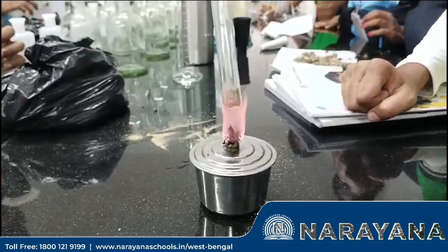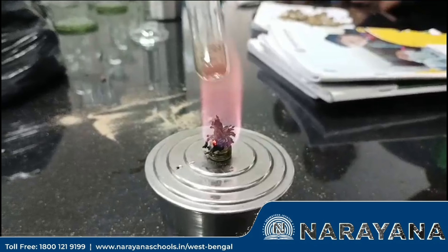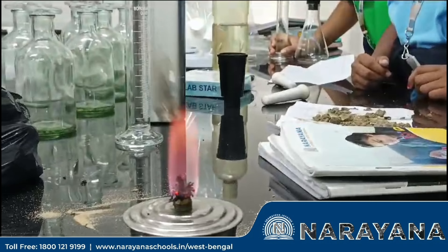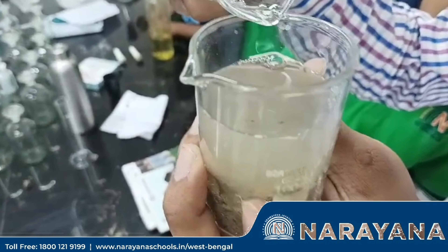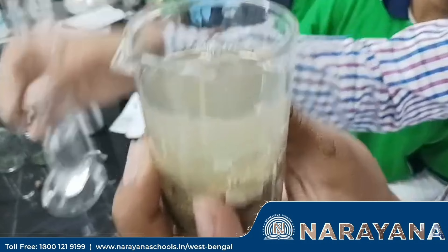Sir, I'm scared, sir. Stop, stop, stop. No, no, no — only one to two ml is required, and then I think this next mode, yes yes yes. Now it's done, okay.